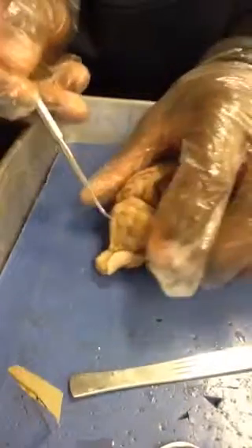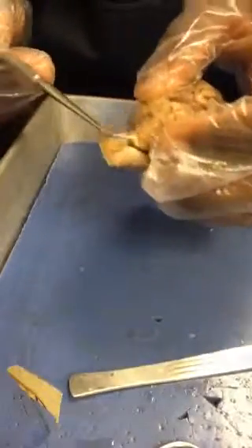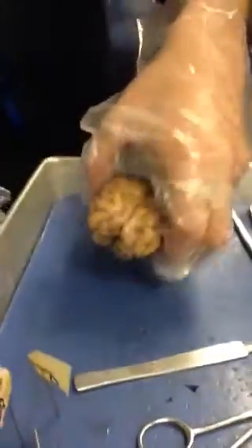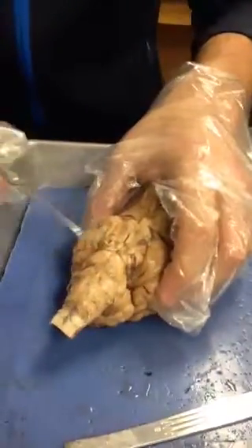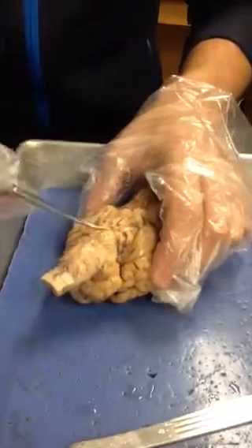Next, we have the medulla oblongata, which is also on the posterior side of the brain, and it's connected to the cerebellum. The medulla oblongata is right here, and it's attached to a lot of the other structures that we will identify. Right here on the ventral side of the sheep brain, we have our pons, which is a very big ball shape right above the medulla oblongata, and it has a very big part also in the brainstem.